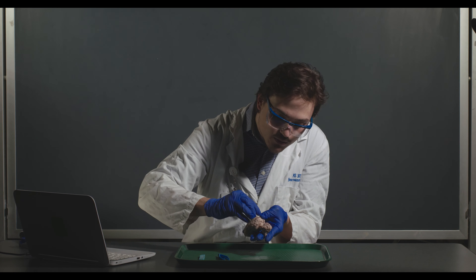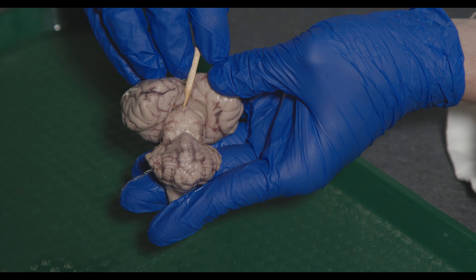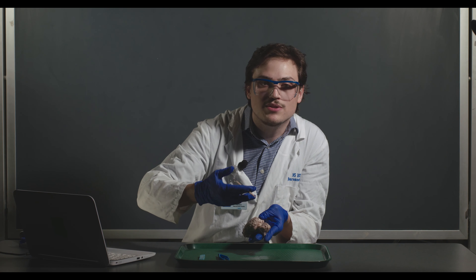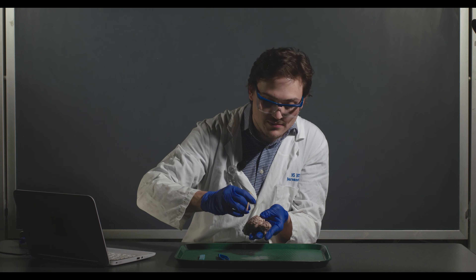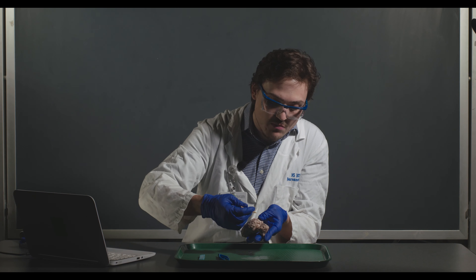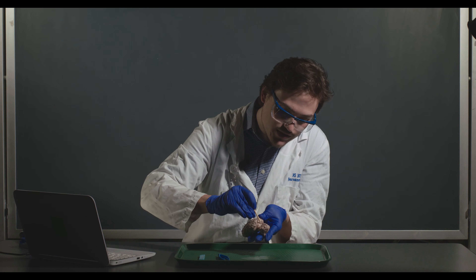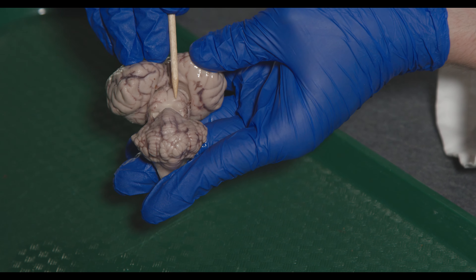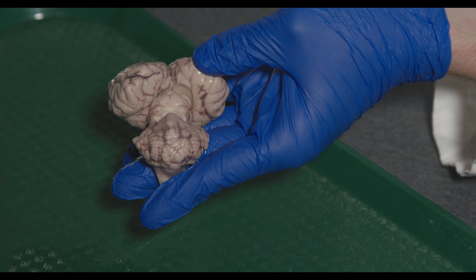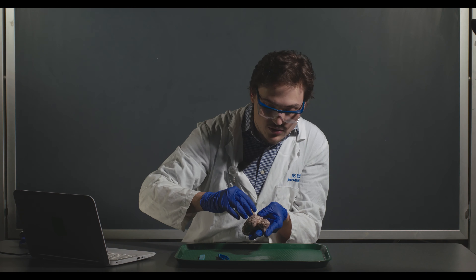In here you'll notice a little bump — that's the pineal gland. It's involved in modulating your circadian rhythm and produces melatonin, the same compound some people take on flights to help them sleep. Interestingly, René Descartes thought the pineal gland was the seat of the soul because it was the only structure in the brain not bilaterally represented — unlike the colliculi, which have left and right sides, the pineal gland is just one structure.